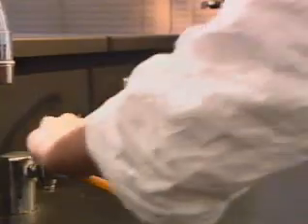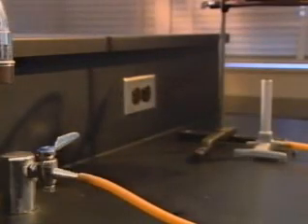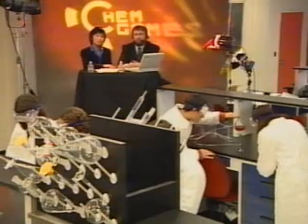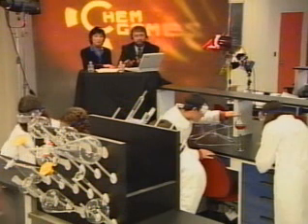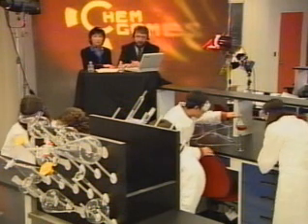Anything else? Never leave a burner burning when you're not there. If you have to leave your workstation, turn it off. And turn off the gas, too. And there are a lot of highly flammable materials like alcohol in every chemistry lab. They should never even go near a flame.